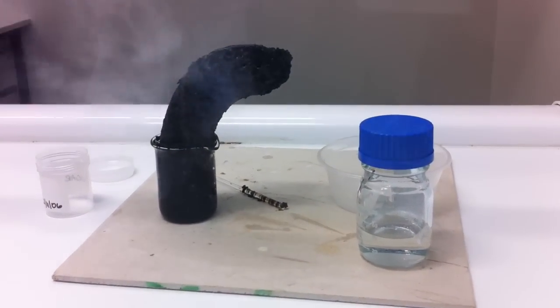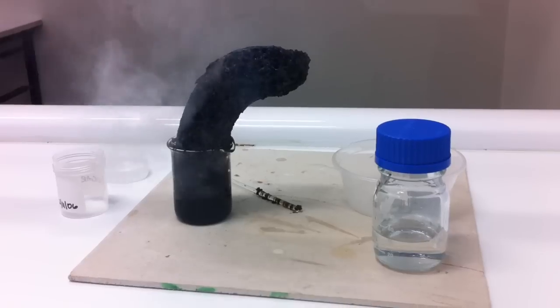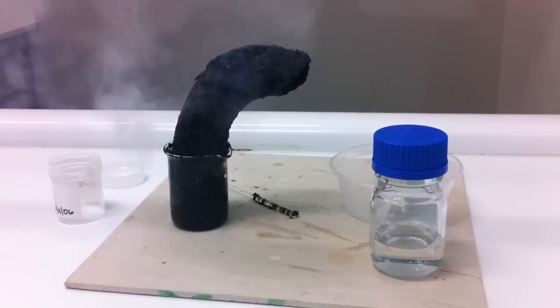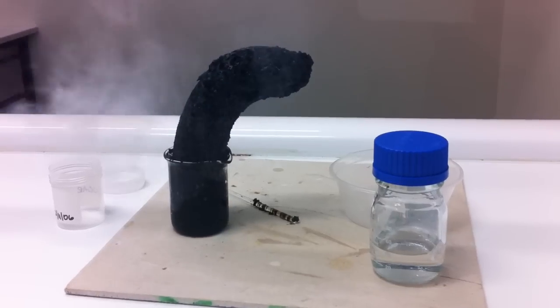Yeah, generated. So if you were to go around and touch that, you'd burn your hand. I actually burned my hand a bit last week when I was touching it, unfortunately. So yeah, a lot of heat is being generated. So it's exothermic.